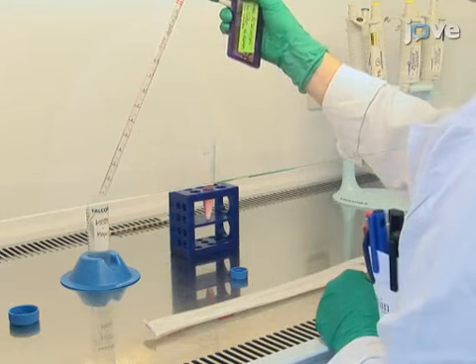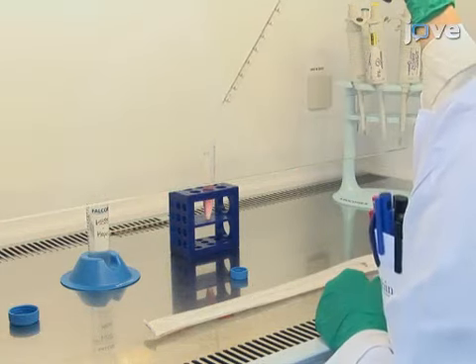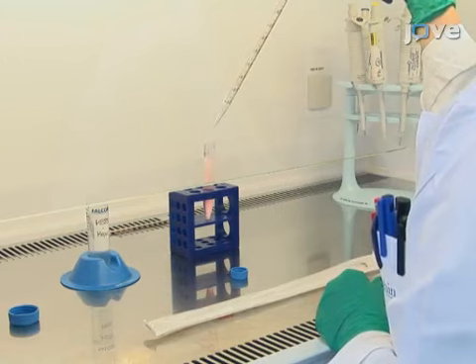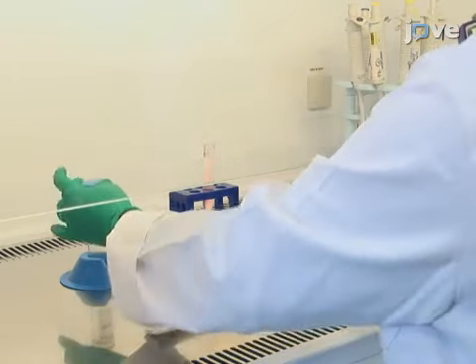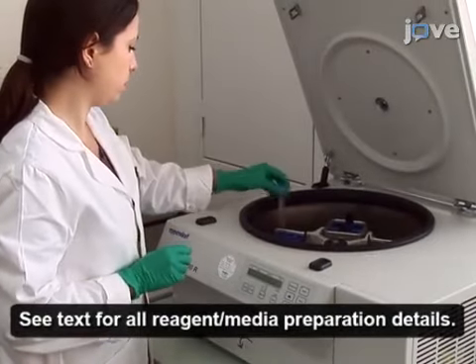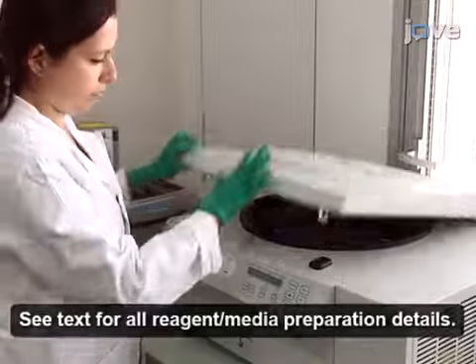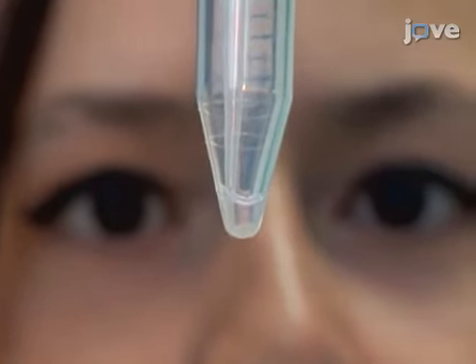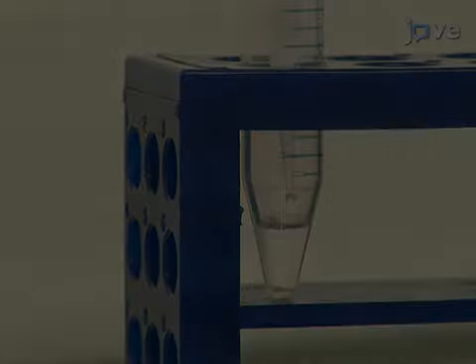For chemokine stimulation of the T cells, begin by washing 5 × 10⁵ cells per experimental condition in warm HBSS supplemented with 10 millimolar HEPES. Centrifuge for 5 minutes at 340 × g at room temperature. Remove the supernatant and resuspend the pellets in 0.3 milliliters of warm HBSS HEPES per tube.